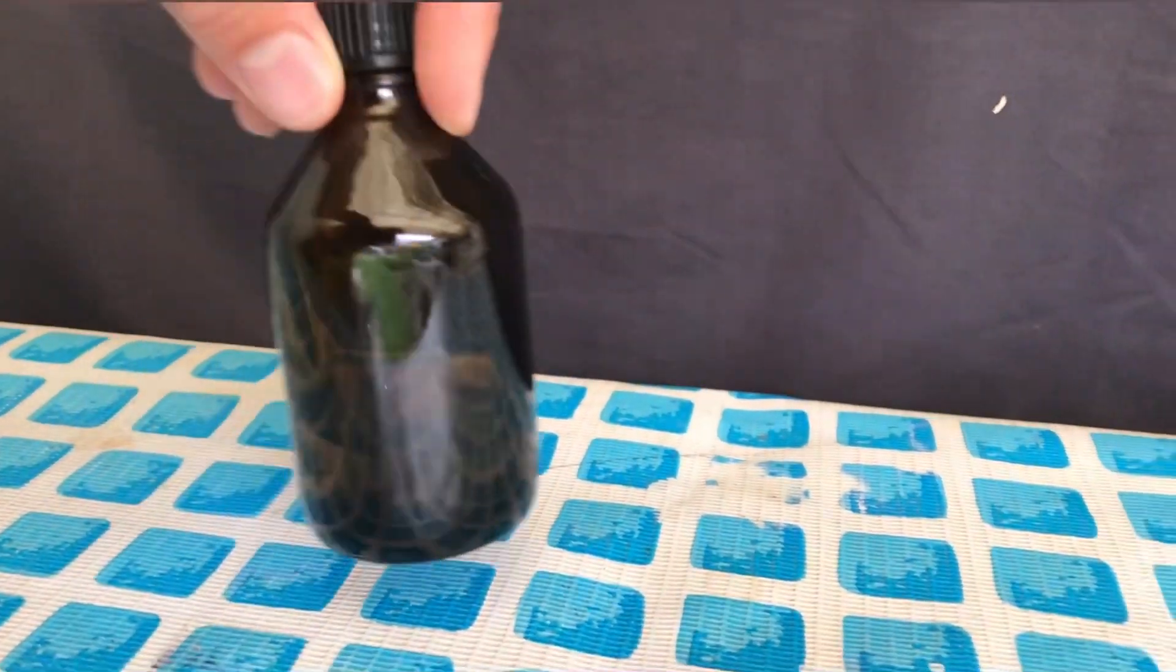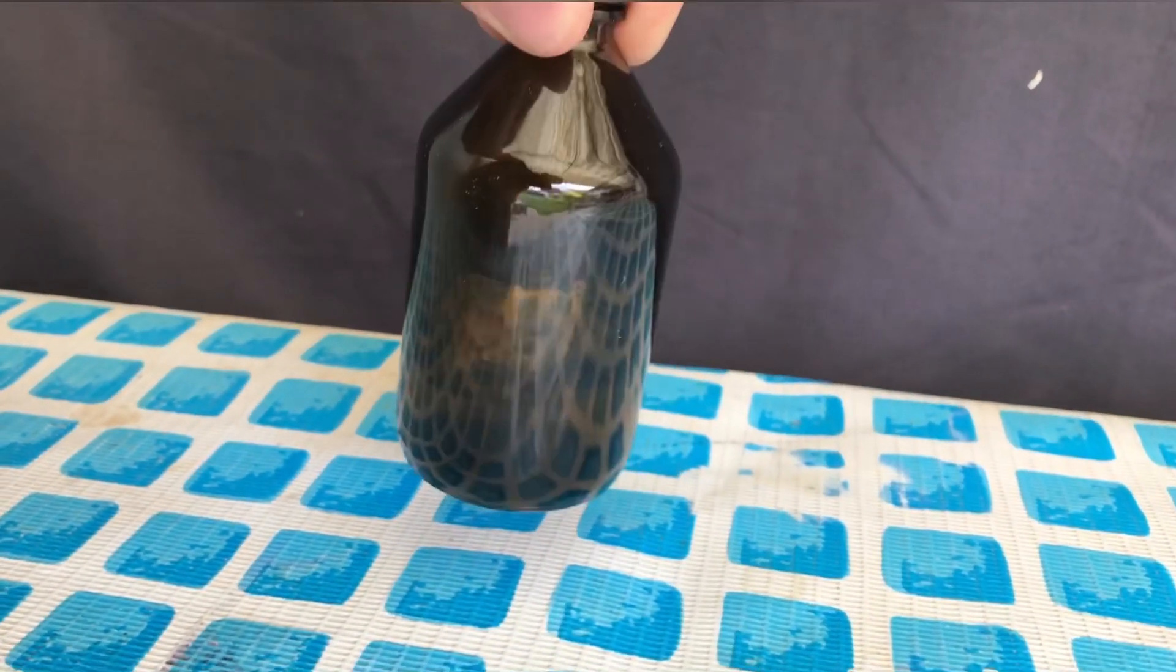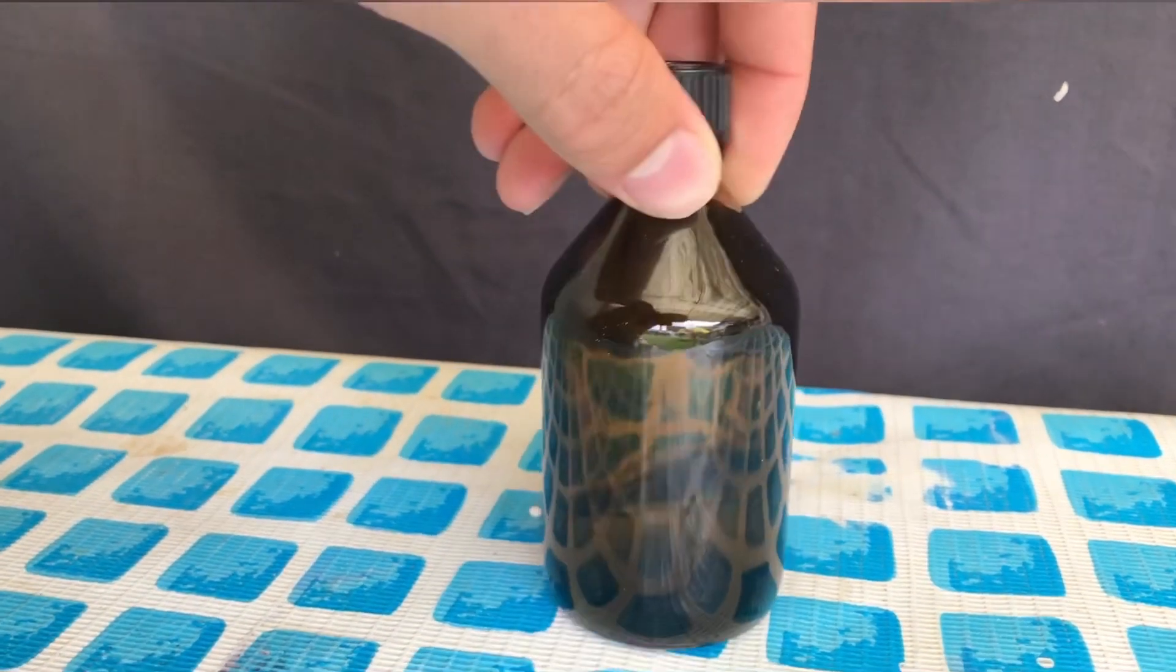And there you go, a nice solution of chloric acid of unknown concentration. I might turn this into perchloric acid someday.